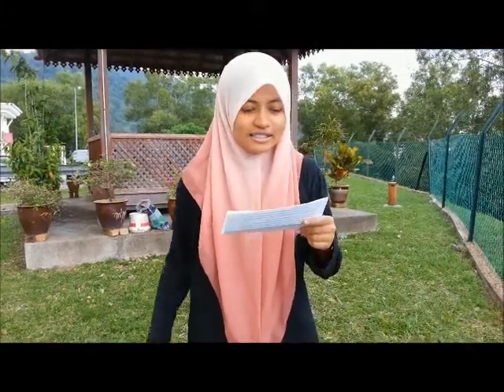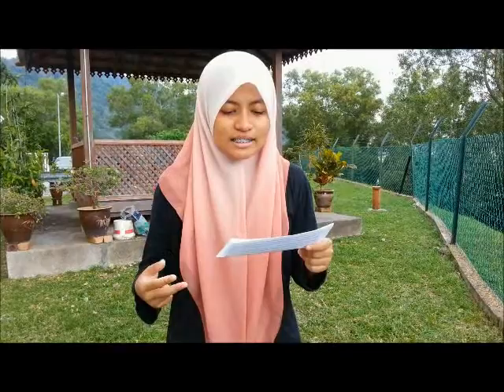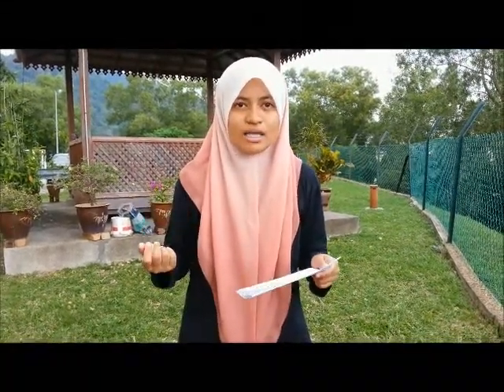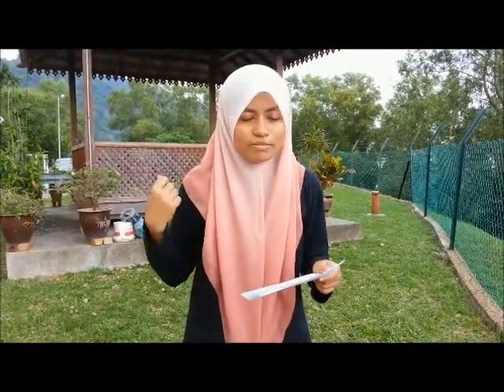In the first section, the erythrocytes are immersed in the hypertonic, hypotonic, and isotonic solutions and distilled water as a control for the comparison in the next sections of the experiment, that is A2 and B. Hypertonic, hypotonic, and isotonic solutions are actually under tonicity. Tonicity is a measure of the osmotic pressure gradient of two solutions separated by a semi-permeable membrane.